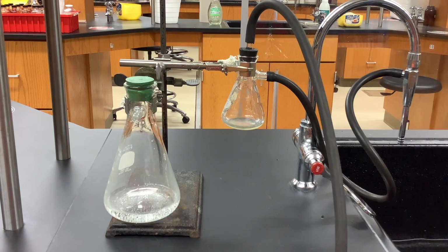You can see there after I tightened the vacuum, we had a lot more bubble formation. As soon as I released the vacuum pressure, meaning I increased the pressure, you could see that I no longer have bubbles forming. I also have a little bit of fog inside of the container. We're just condensing some of the vapor that was being generated when we were at low pressure.